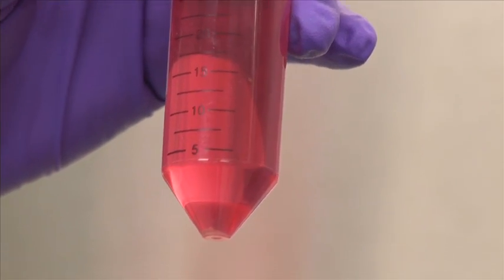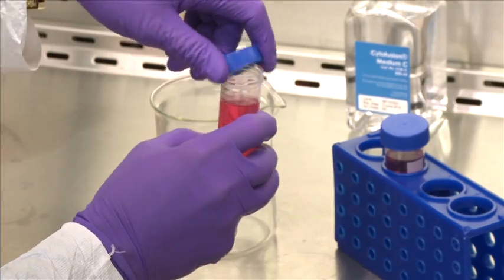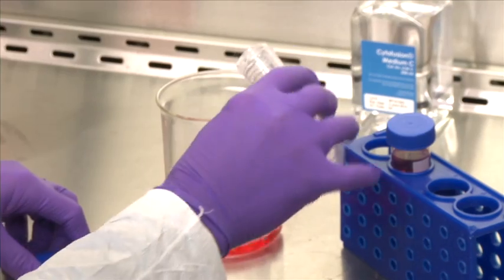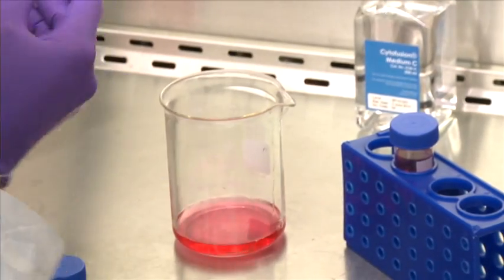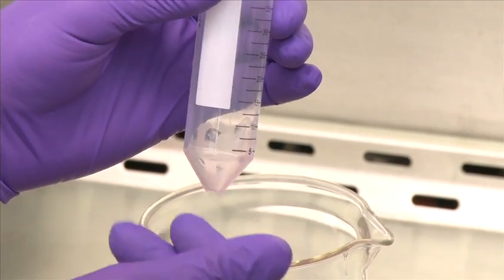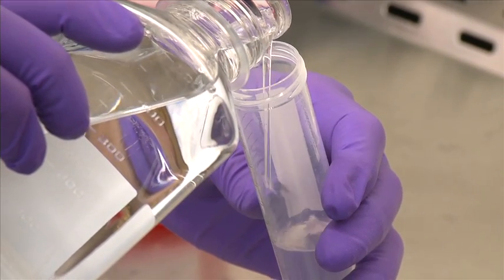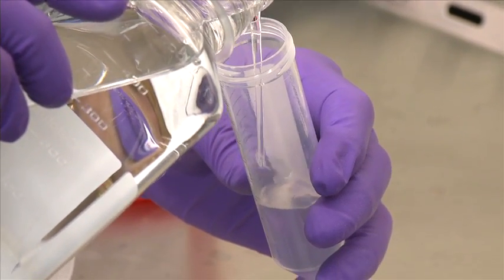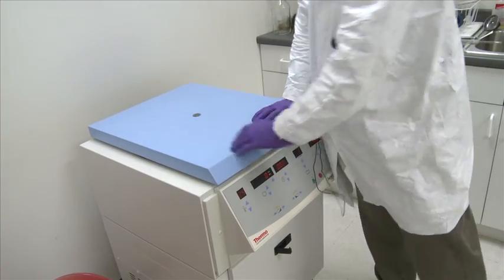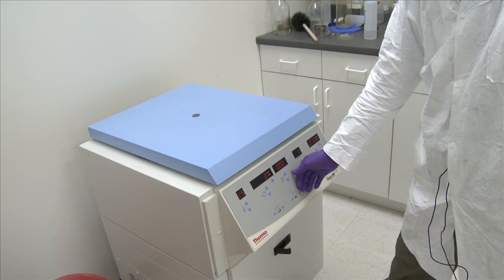Bring up to 50 mL with media and centrifuge at 400g for 7 minutes at room temperature. After centrifugation, you should see a pellet. Pour off the supernatant and break up the pellet by flicking the tube gently. To wash the cells, add about 30 mL of cytofusion media and centrifuge at 400g for 7 minutes at room temperature. Repeat twice.